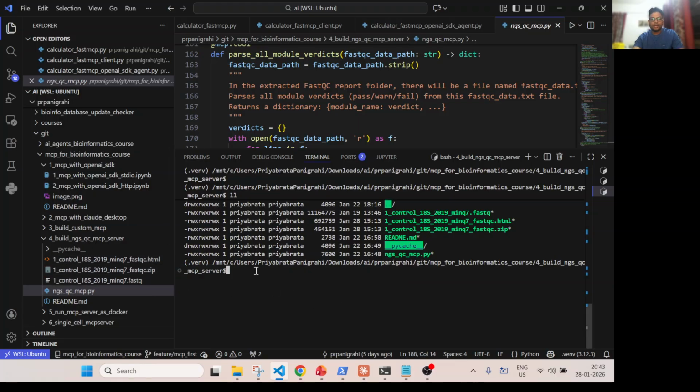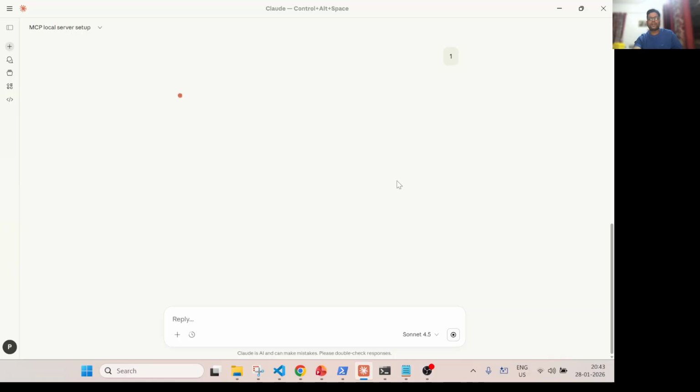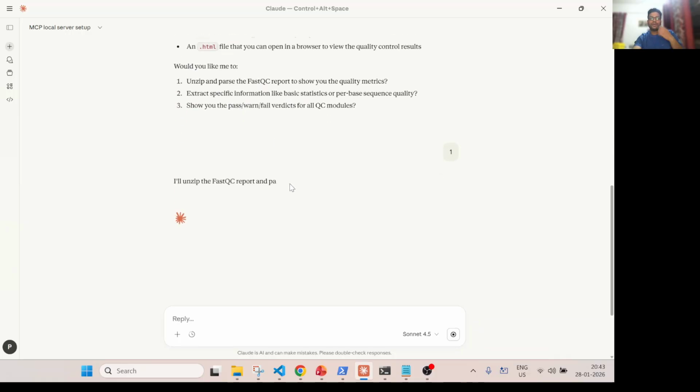Okay, so now in the next step we need to extract it, right? So it automatically says that the output should include a zip file and HTML. So now you do unzip, extract, and we'll just say one. So that means unzip. Okay, so I'm just giving one option, that means unzip it. So now it will do the unzip.